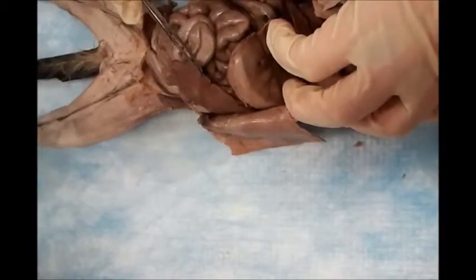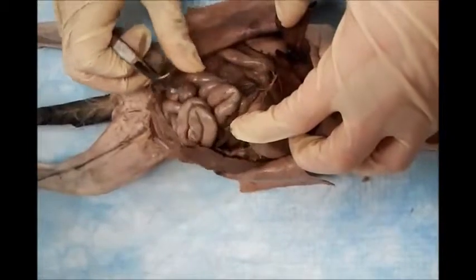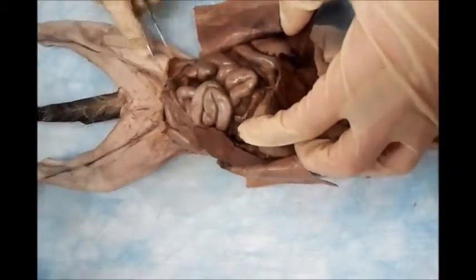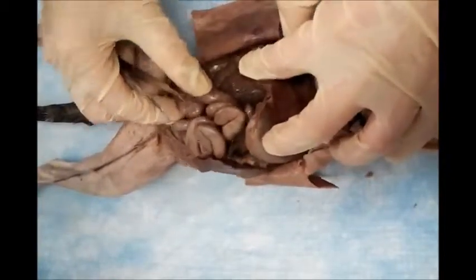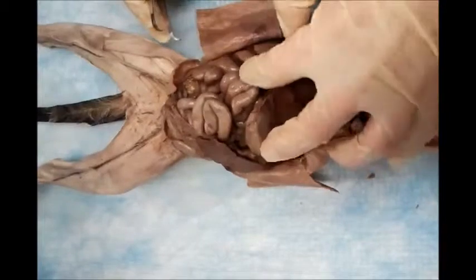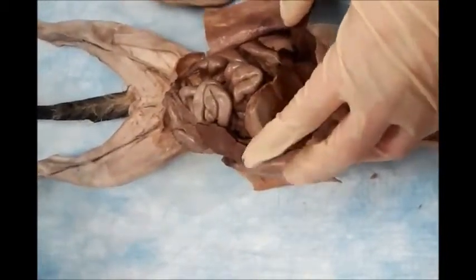Parts of the small intestine: the first part is the duodenum. Next to it is going to be named jejunum, the few loops next to the duodenum, and then the last loops are going to be named ileum, where they end into the large intestine. Okay, so that is about the small intestine and the large intestine.